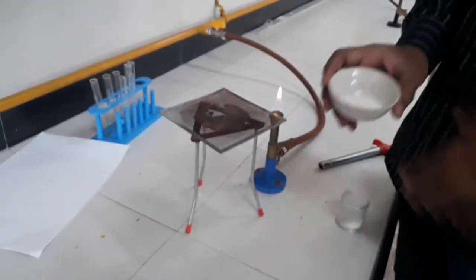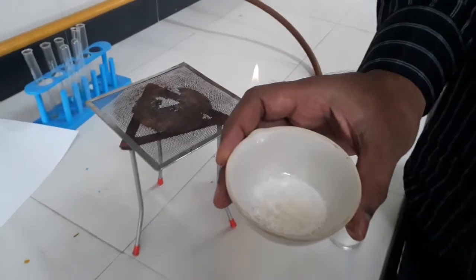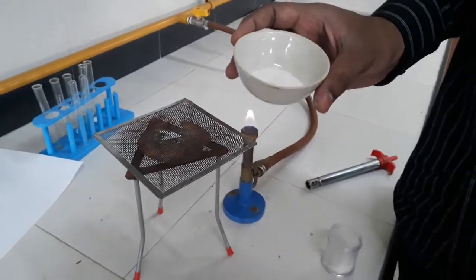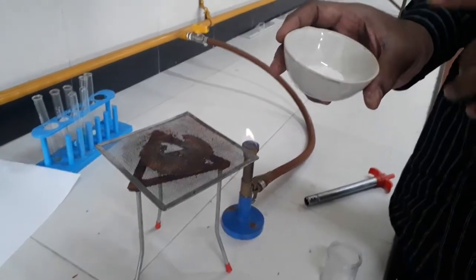That's why when we heat this alum, we have taken alum powder in a porcelain dish or heating dish. When we heat this alum, you can see a lot of changes in it, and those changes show that water of crystallization is present in it.